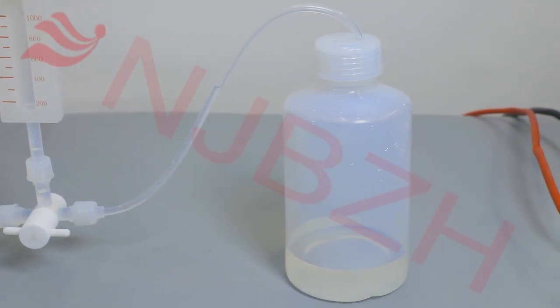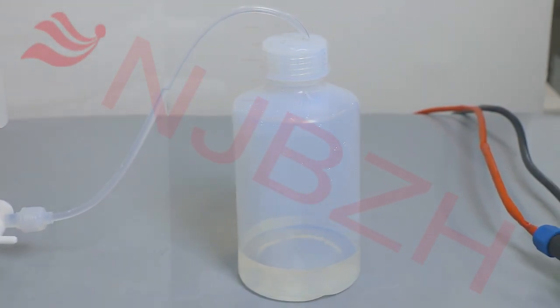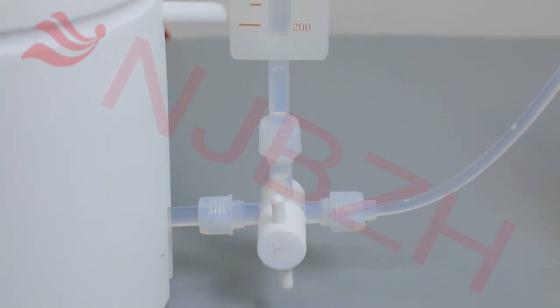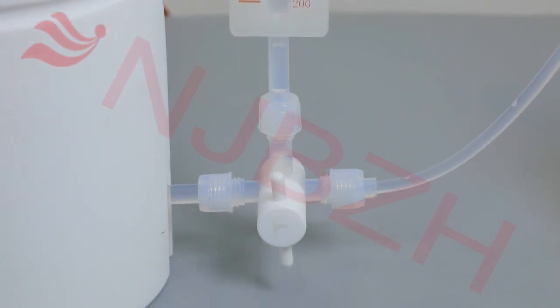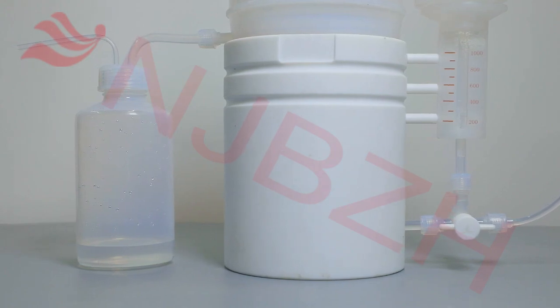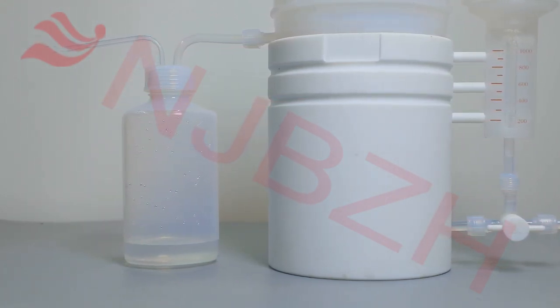...a liquid crystal touch screen, a ring-shaped silicone heating jacket, a liquid level gauge with a scale, and a pagoda-shaped condensation chamber.